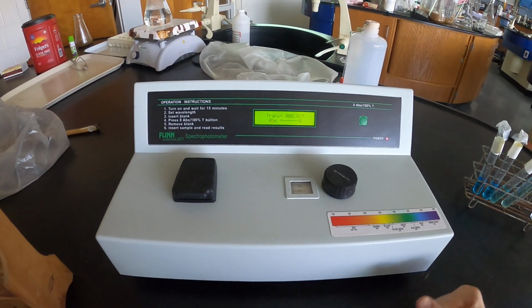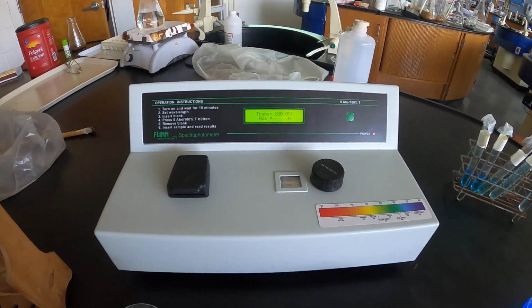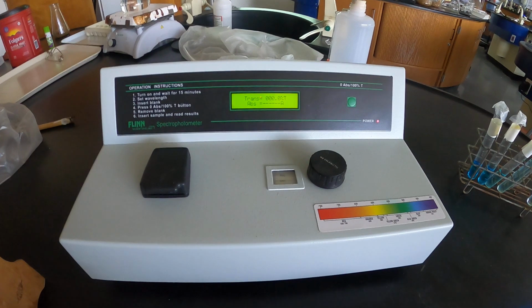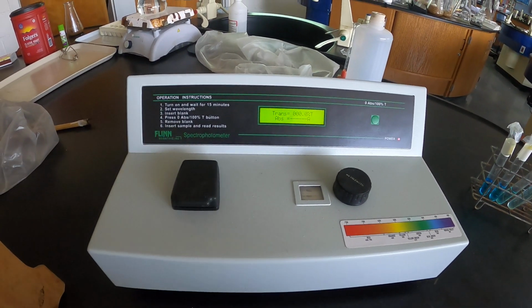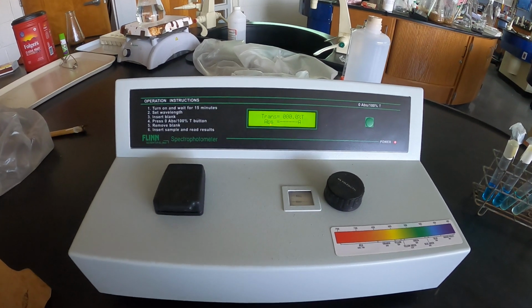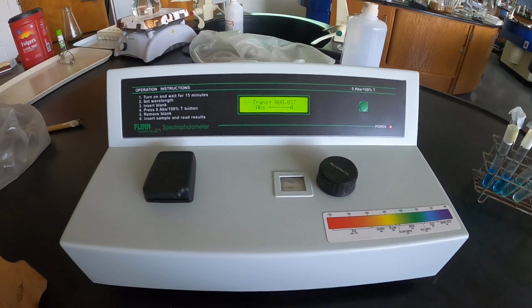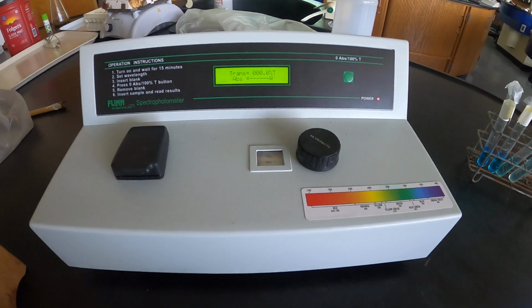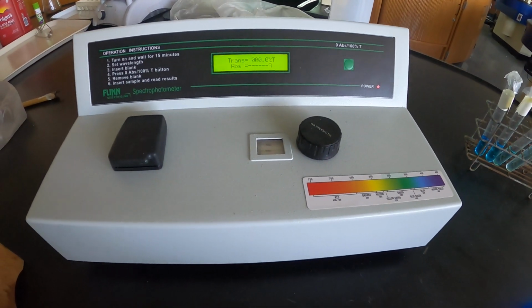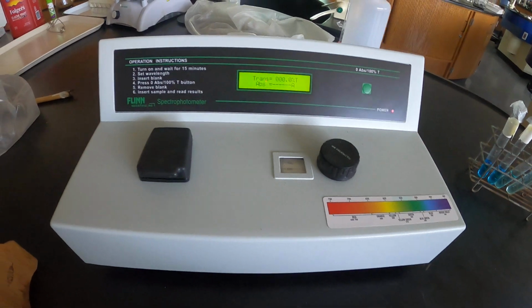I've had students in the past reach out to me, tell me about their progress and say, yeah, we did that same exact lab on the same exact instrument. So not only are you getting collegiate level experience of what chemistry looks like, but this is also very true to form to how this type of spectroscopy is done in industry. So I'm going to walk you through this.